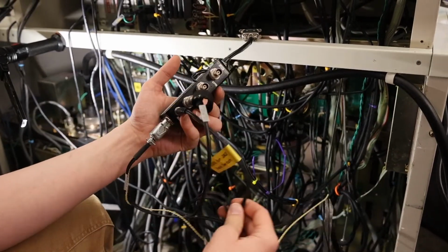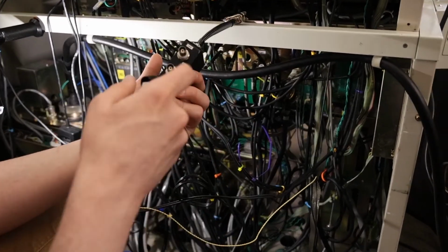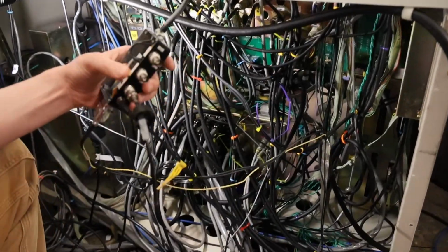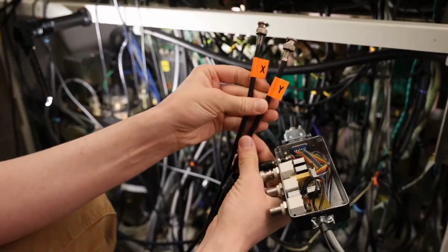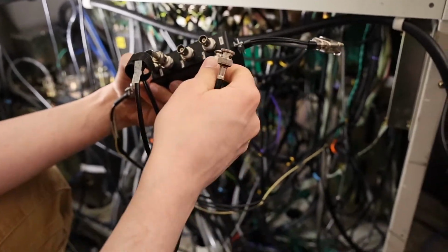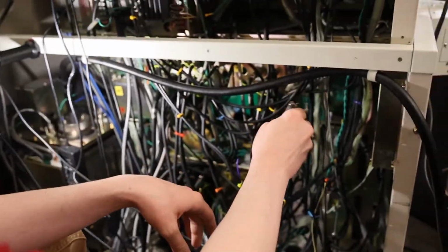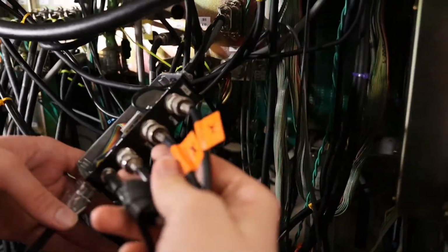So this is the power for this particular box, because this box needs 5 volts for its relays. And this BNC cable here on the enable pin goes to a little manual switch on the front of the microscope that lets us flip back and forth. And then these are X and Y inputs. I did run the cables earlier for this. I've got the BNCs we're using for X and Y that are going to connect to open beam interface in the front. X is going to go here and Y is going to go here. So that is our scan signals routed. Now we're going to plug that back into JA2 and make sure that gets latched in, and cool. So that's our scanning done.